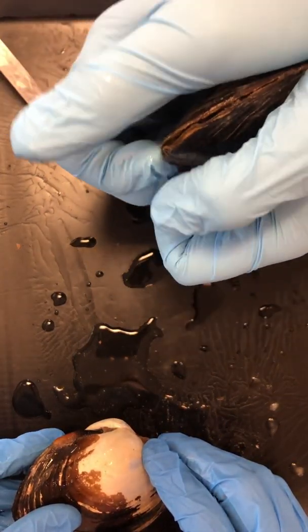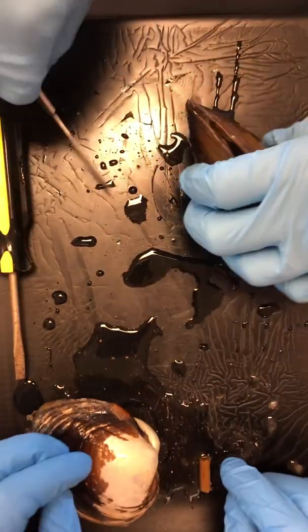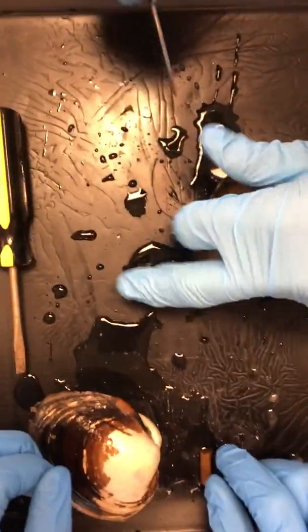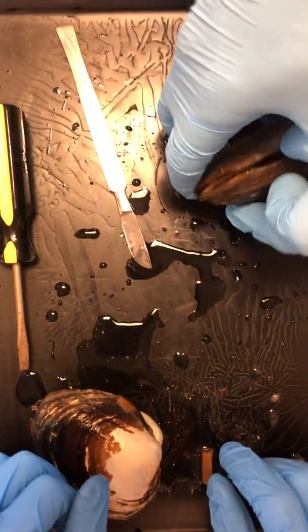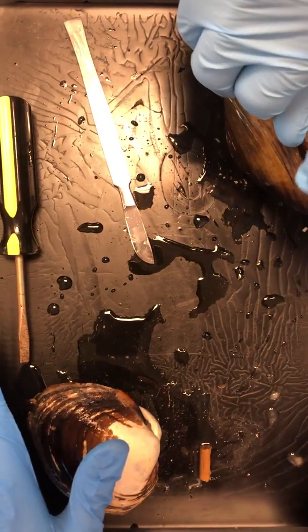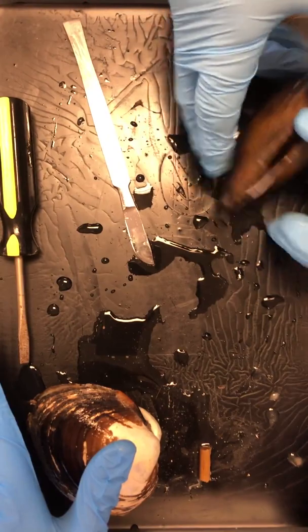Gave you the hardest to open muscle. I don't think I cut enough. Oh man, it's a little... That or I don't have enough muscles. You should be doing those PE class workout exercises that I've been suggesting. Yeah, grip training. Grip training. Ready? Aha! I hear it.